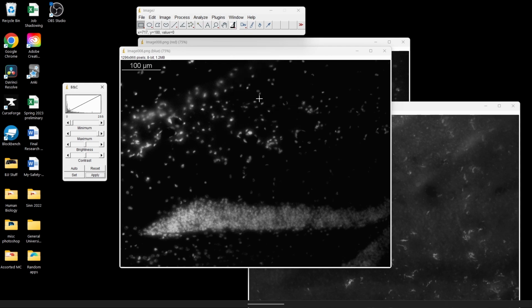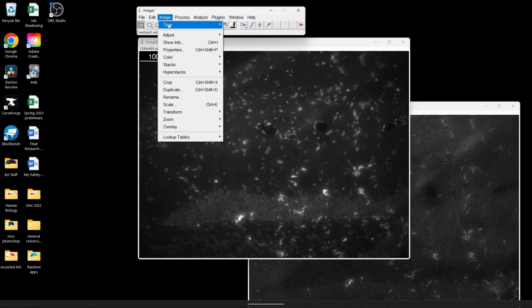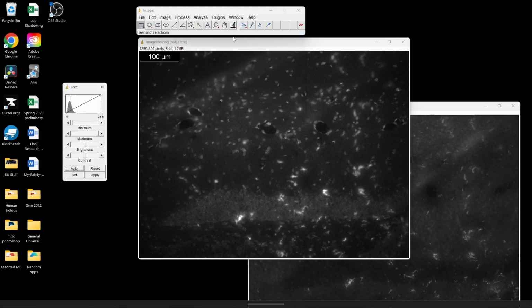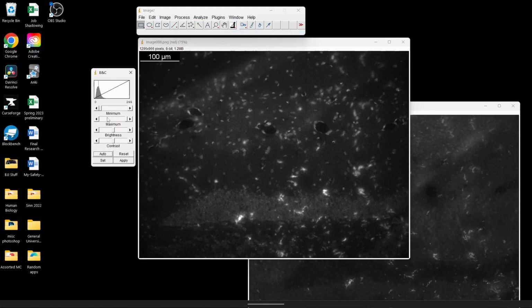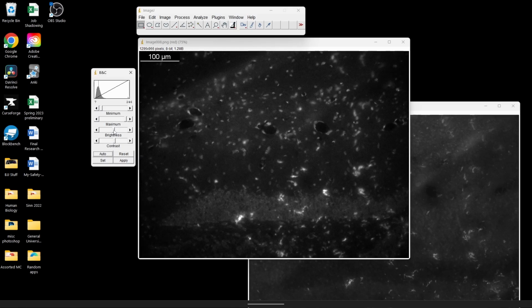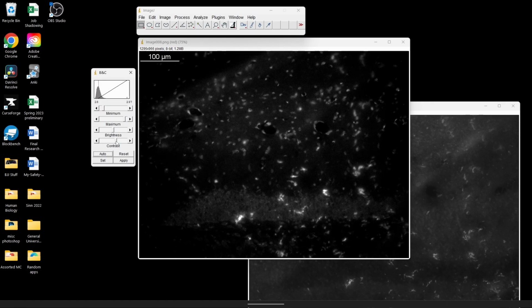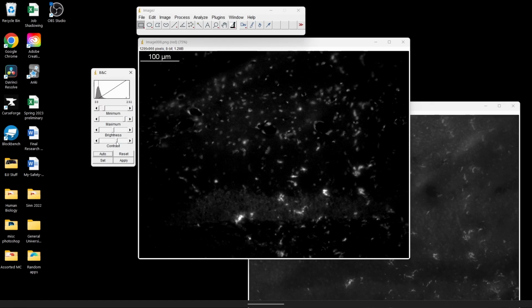Great. Now we're going to our next one. This is our red channel. We're going to go same thing, adjust, brightness, contrast. Now, especially with our non-DAPI channels, we want to start with bringing up the minimum when we've got a lot of background. That's just a really good place to start. And then we can start messing around with the brightness and the contrast. I'd like this to be brighter than it is, just by a bit.